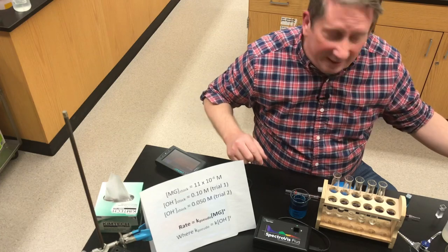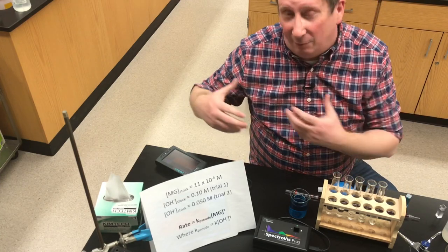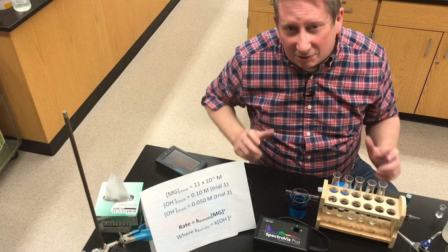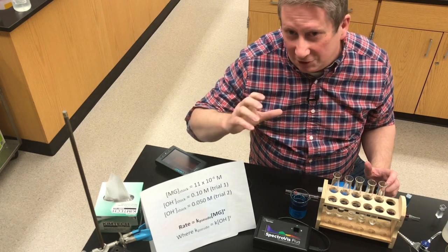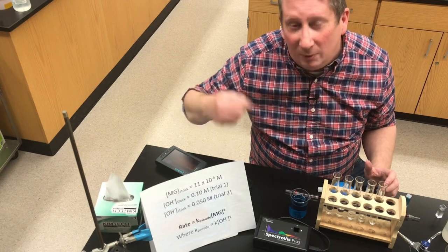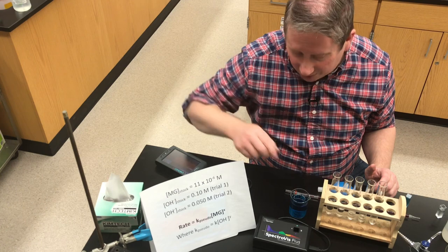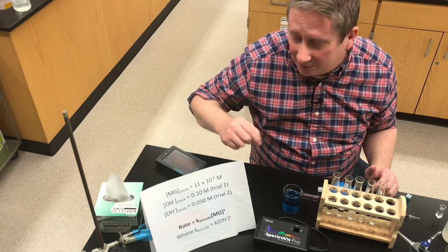When you have more than one reactant, that lends itself to a differential rate law analysis, but it makes an integrated rate law analysis harder. In an integrated rate law lab, you can only have one concentration changing over time. So with two reactants, we have to play a little trick — we're going to use a very dilute stock solution of the malachite green.